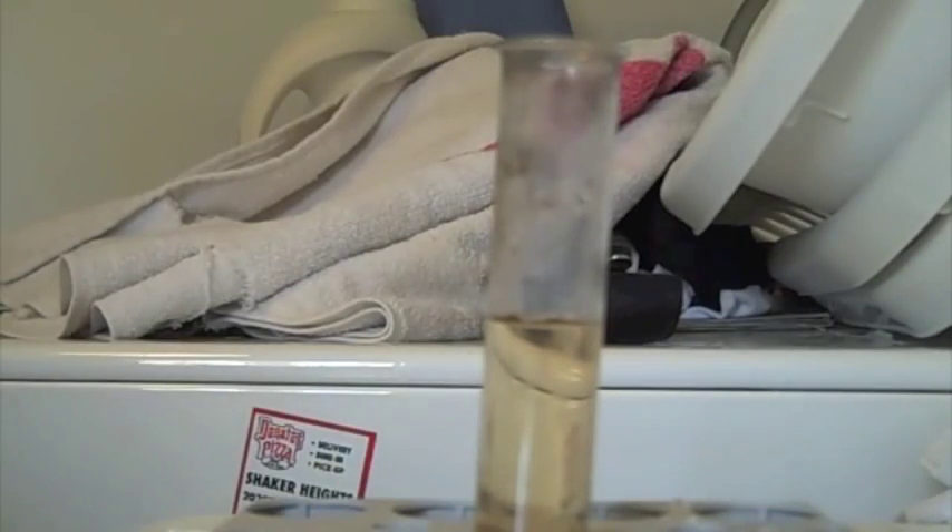Now I'm going to add a few drops of potassium hexacyanoferrate, and you'll see the wonderful blue color that comes out. I'm getting my supplies ready right now. There's my potassium hexacyanoferrate in solution, and I'm going to open it up. Notice any color changes.